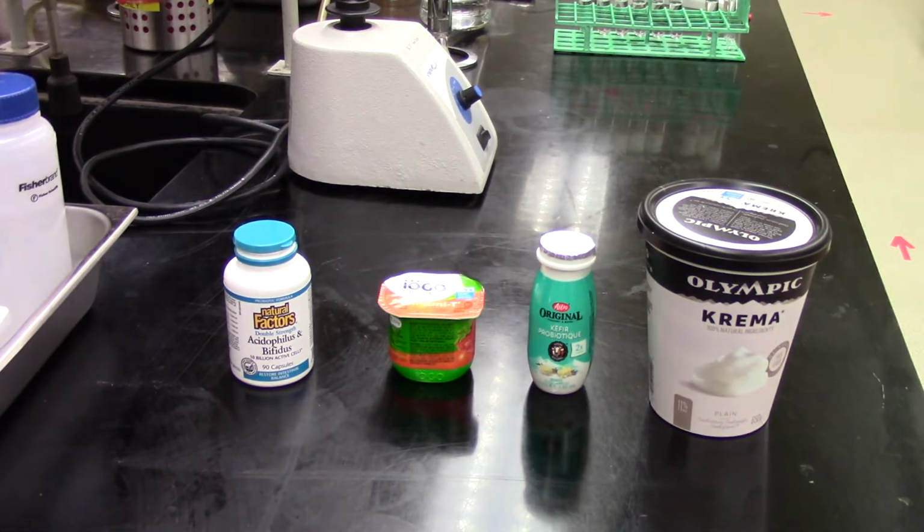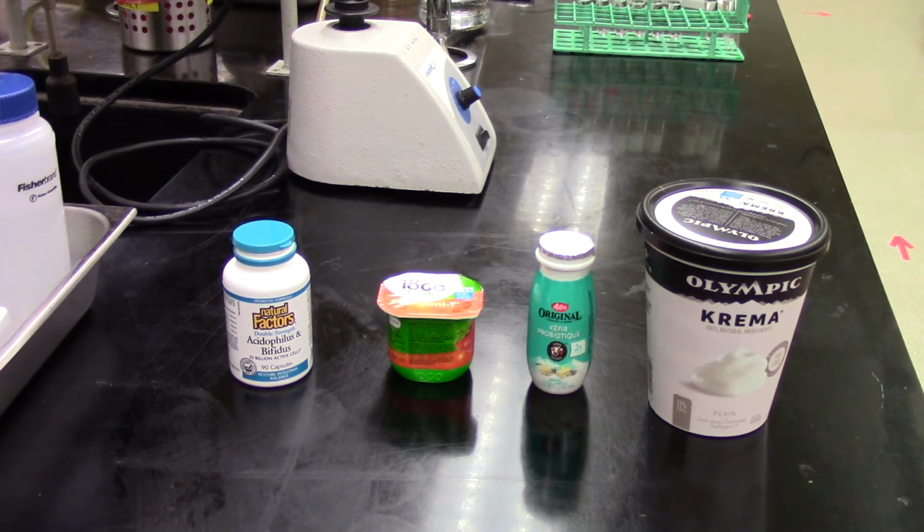So what we're going to do first is prepare our samples. We're going to get ready with a dilution, essentially, of these so that we have a liquid sample that we can then start diluting further in order to make our spread plates. The spread plates we'll see in a later video. So we're going to start off right now with just getting these ready to make our dilution and then eventually make our spread plates.